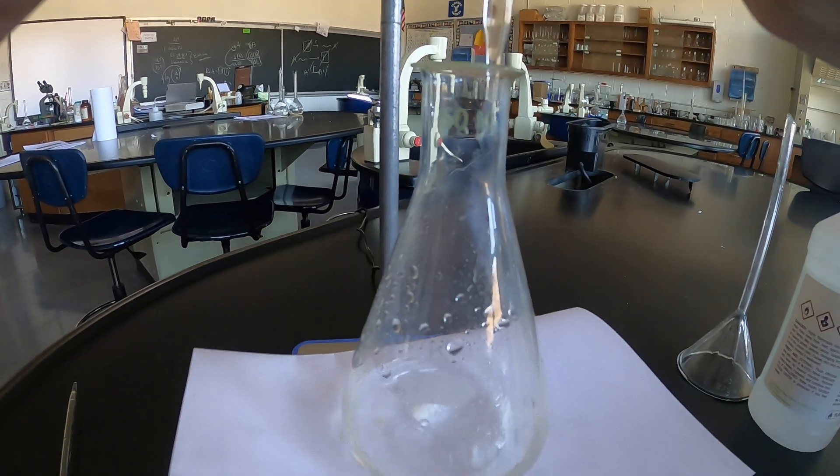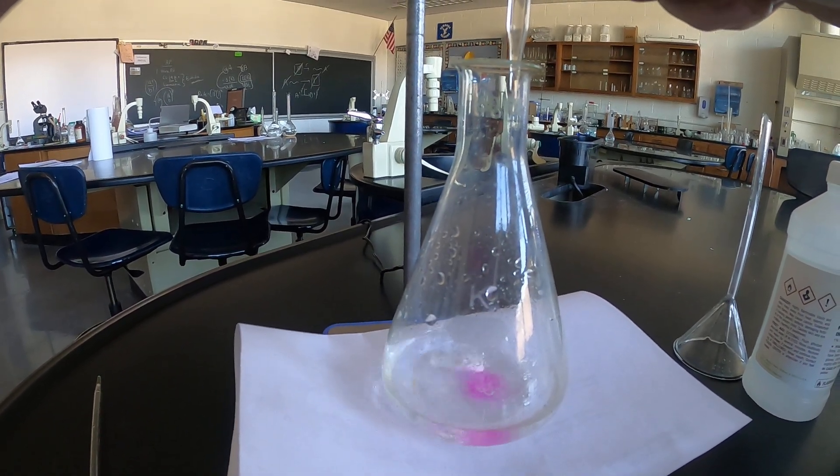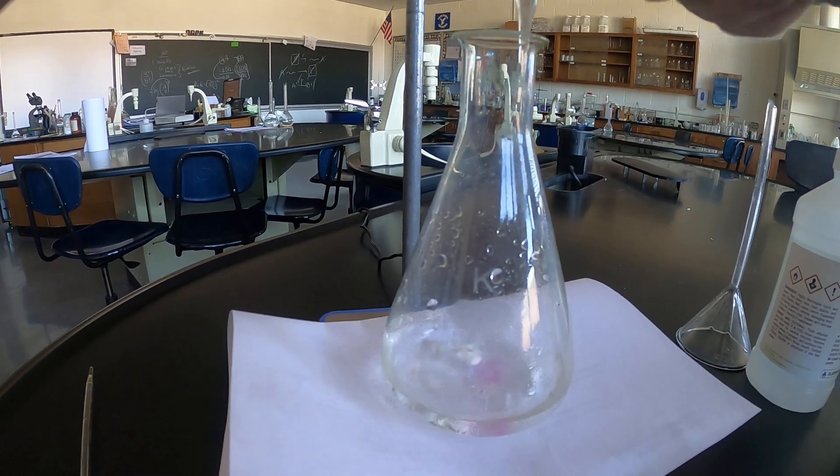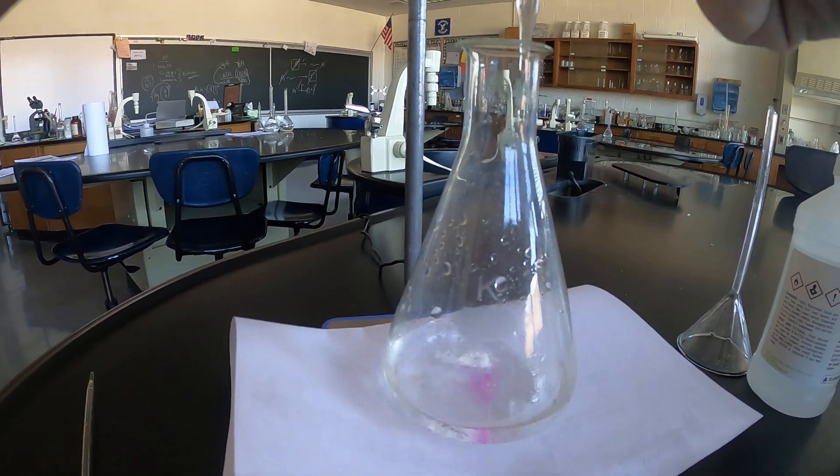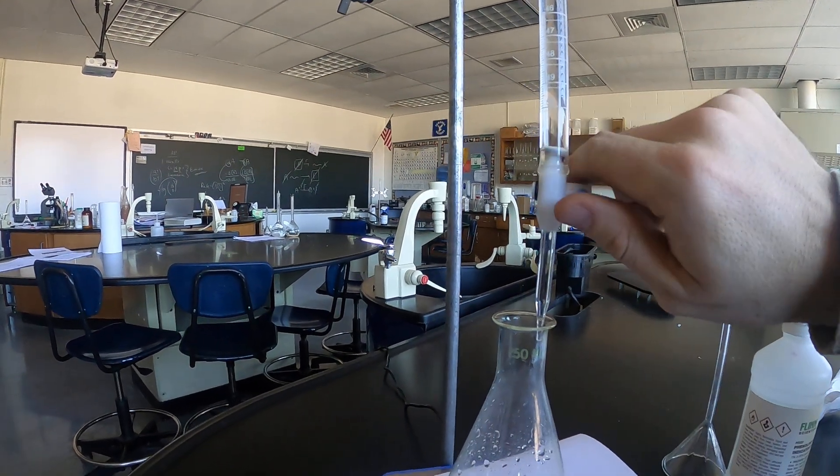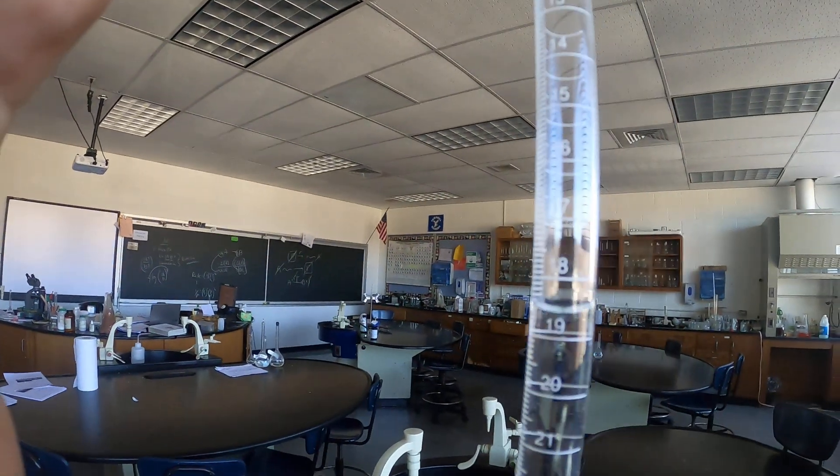Okay, still getting titrated away. And I know I'm getting closer to my endpoint as that pink color sticks around a little bit longer. I'm now rotating my stopcock a full rotation essentially or a half rotation which lets out a decent amount of titrant. Alright now I'm at 19.